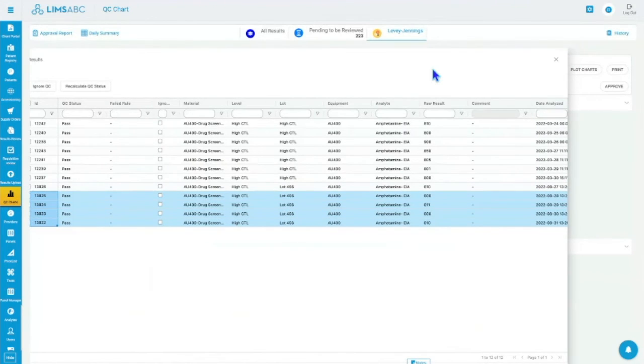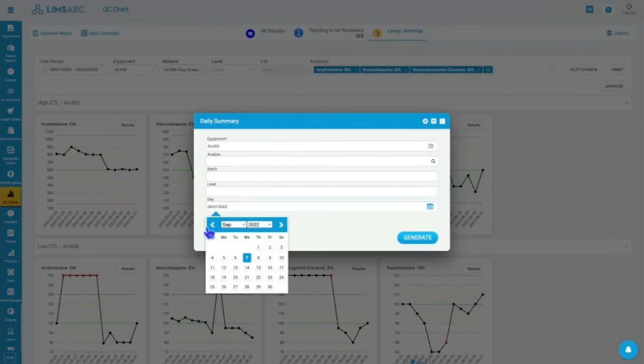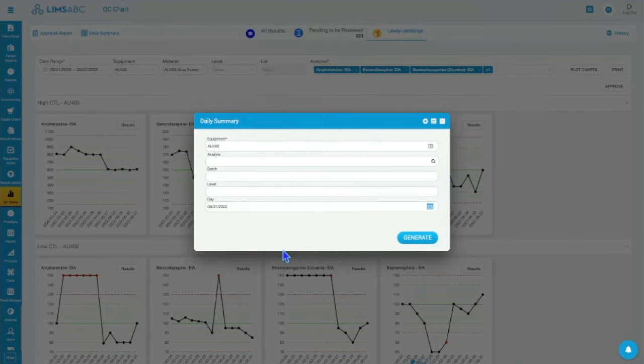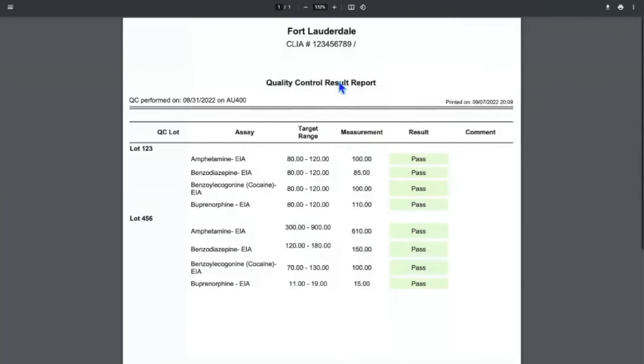Okay, so if I go to my daily, I think it was this one, and it was the 31st. Let me see if I get that report. I should get this. It can be customized, and this is what gives you your daily summary report for that day, right? So usually we have clients that would print these.